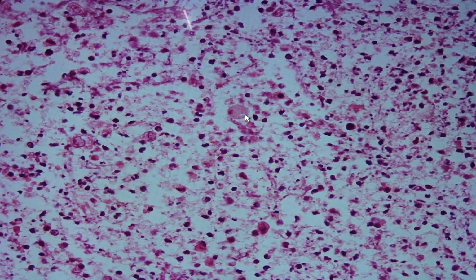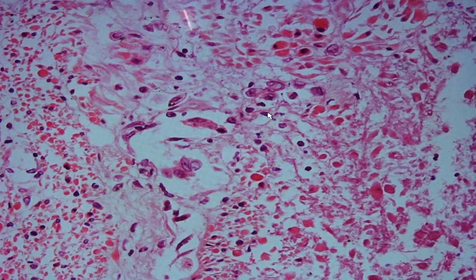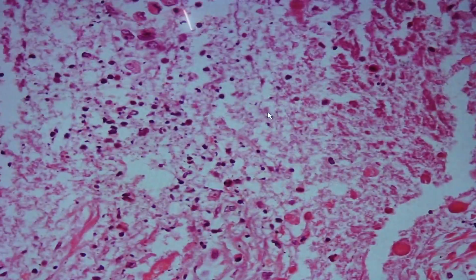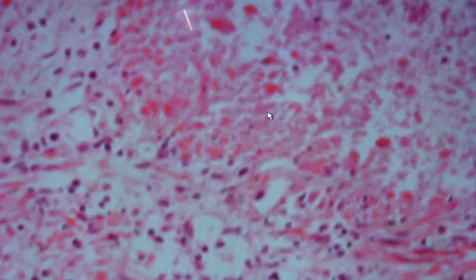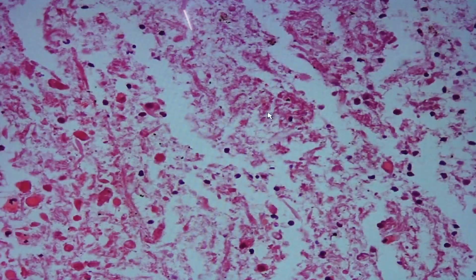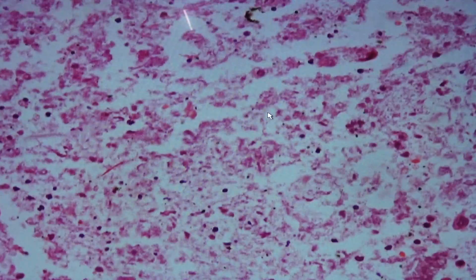So an Entamoeba histolytica trophozoite would present with one nucleus, unlike that of the cyst wherein you see the presence of 4 karyosomes. Okay? So you have 4 nuclei. But in this case, you have 1 nucleus. How do you differentiate this from E. dispar? Anyone? Okay, so you can differentiate them if you would see the presence of erythrocyte within the cytoplasm.